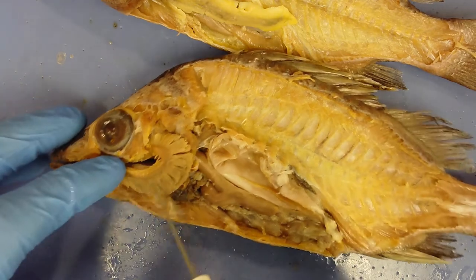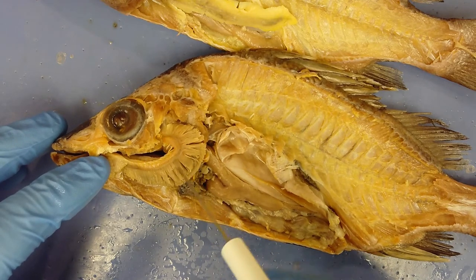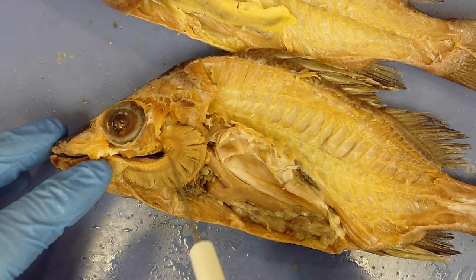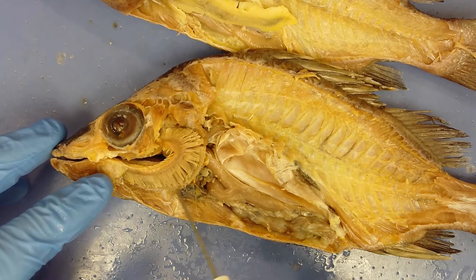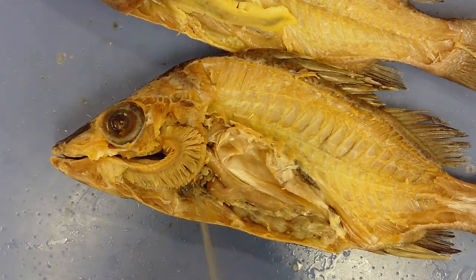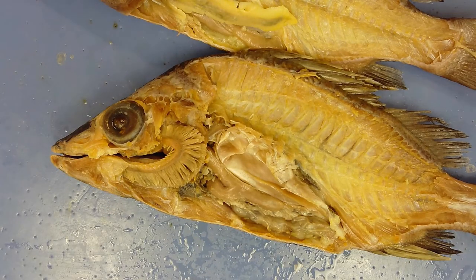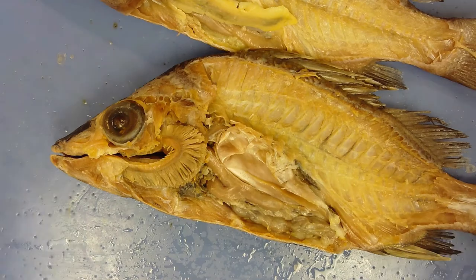The gills are made up of several structures. The gill arch is C-shaped in the middle. On the inside of that C are rigid spine-like structures called gill rakers. On the outside of the gill arch are feather-like structures called gill filaments. Under a microscope, these filaments branch like feathers to increase surface area — each branch is called a gill lamella.